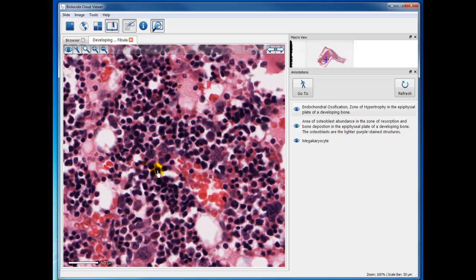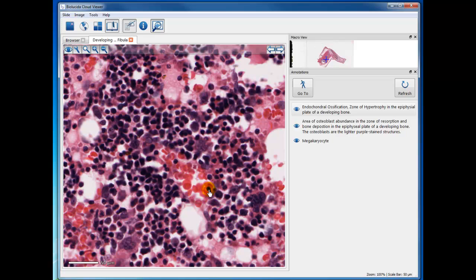Most of the cells in here would be developing lymphocytes and various leukocytes like neutrophils and monocytes. And occasionally here where you see very dark, this could be a nucleus of a lymphocyte, and over here where this looks rather oblong, this could be a cell nucleus of a developing red blood cell.